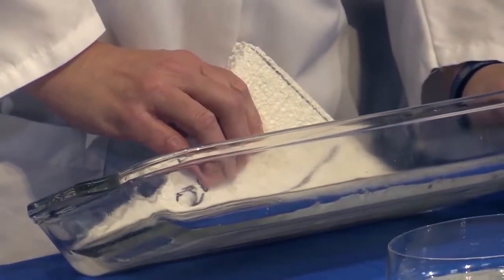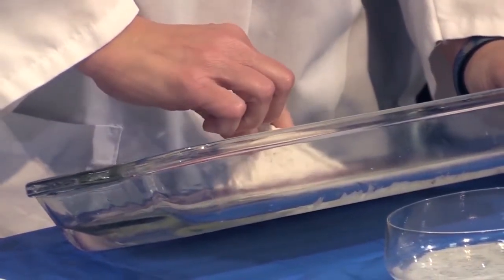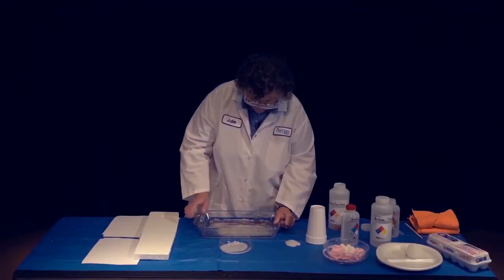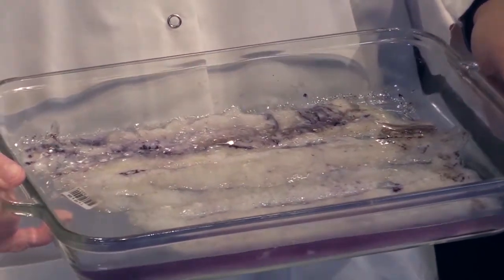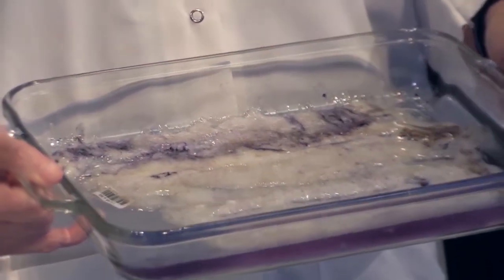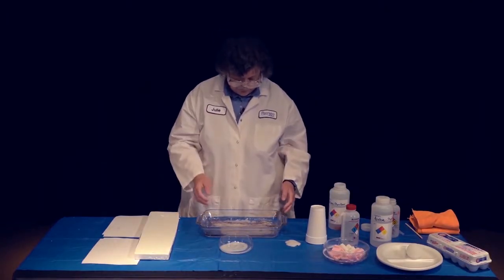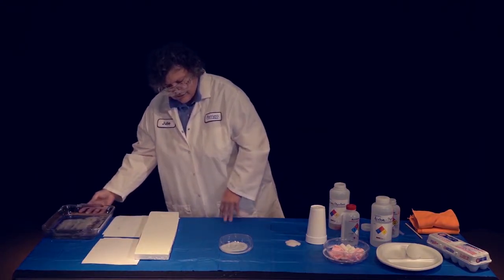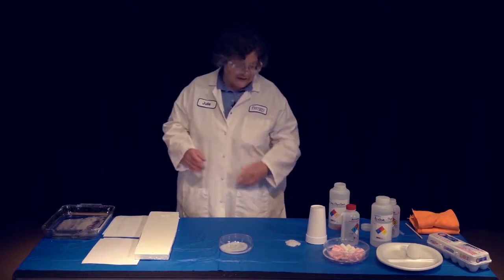I'm going to tip the tray a little bit so we can take advantage of the unused acetone. So here you can see that that big, huge sheet of styrofoam is made of only that much polystyrene. That's a whole lot less than that big sheet we had. So I mentioned to you that styrofoam is made by pushing things into a particular shape.